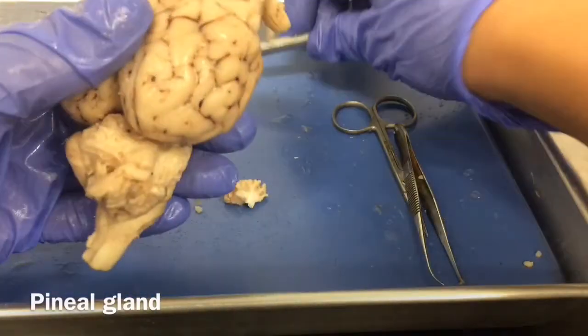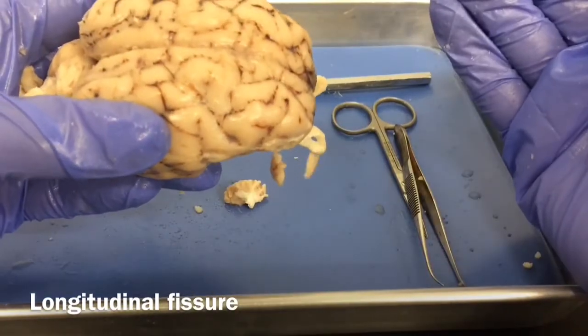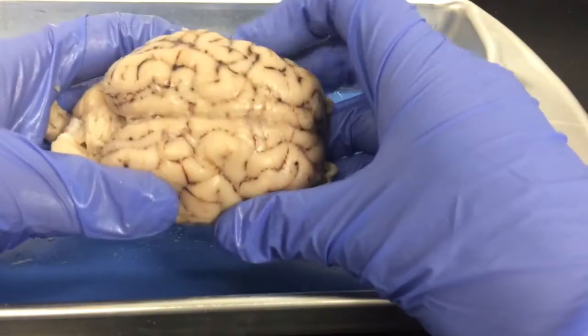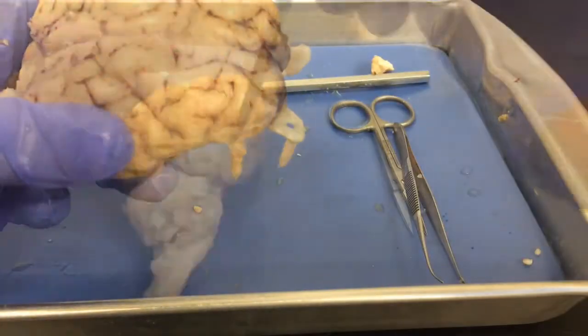Okay, so now we're going to take up our scalpel, and we're going to use our longitudinal fissure, so this line right here, as a guide, and we're going to separate the brain into our left and our right hemispheres. So be very careful where you're cutting this. You want to still be able to see the structures, and it's very helpful to use a sharp scalpel while you're doing this part. So here we go.